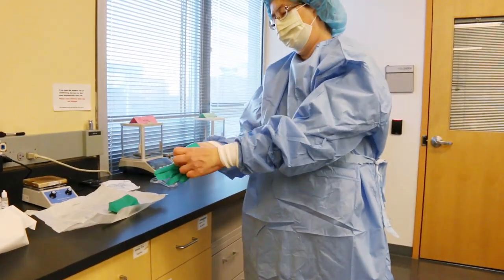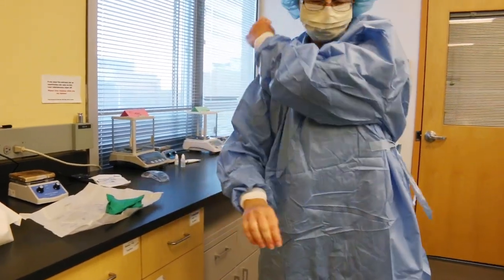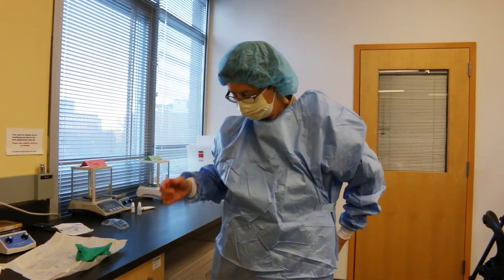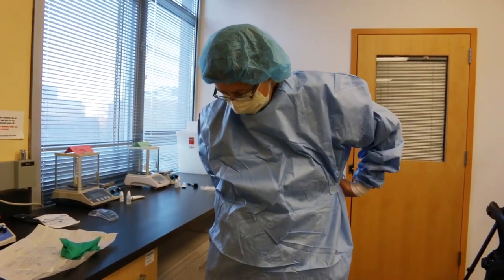27A, grasp the cuff of one glove and pull that glove down and off of your hand. While grasping removed glove and gloved hand, grasp the cuff and pull the glove of the other hand. Dispose of the glove bundle.